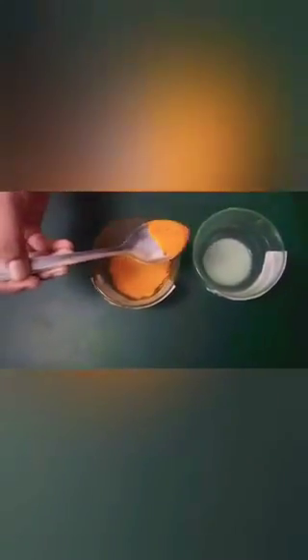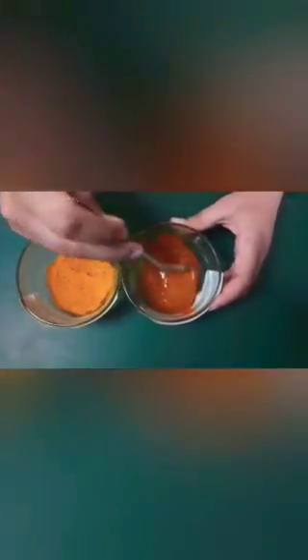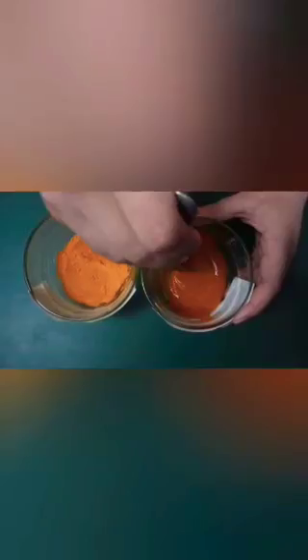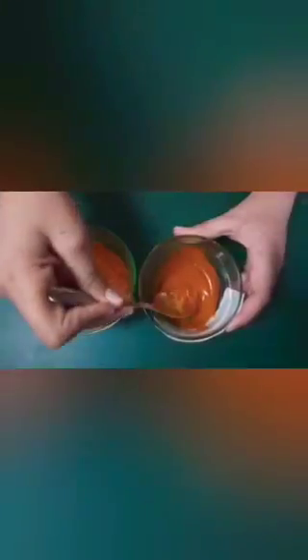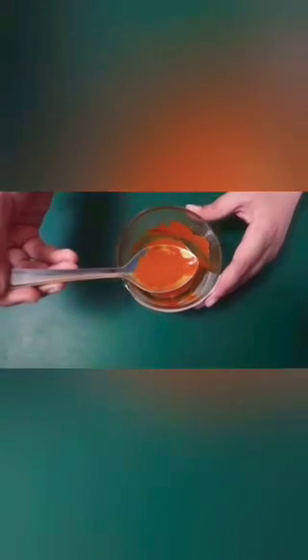Friends, soap solution is also mildly basic in nature. You can see that turmeric, which is yellow, changed to deep red when soap solution was added to it. Friends, can you see that this is the deep red color?